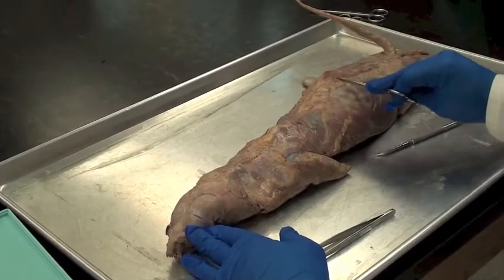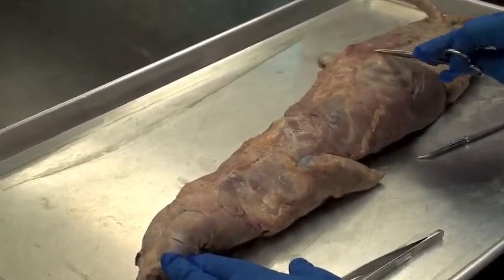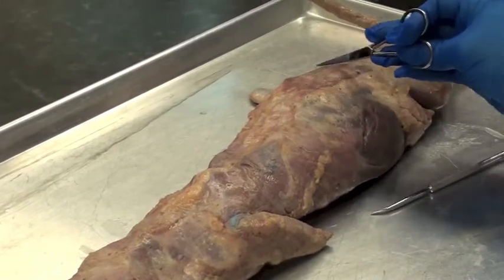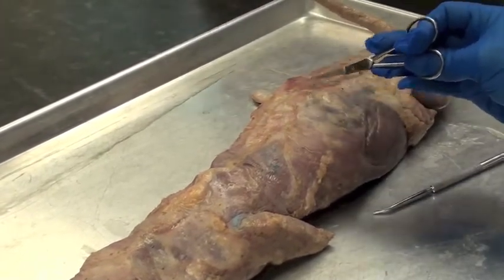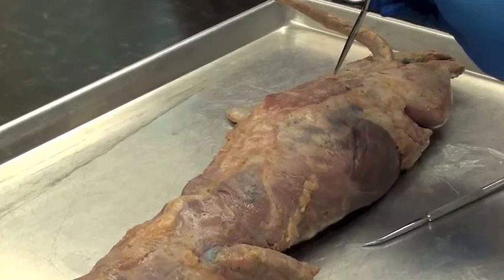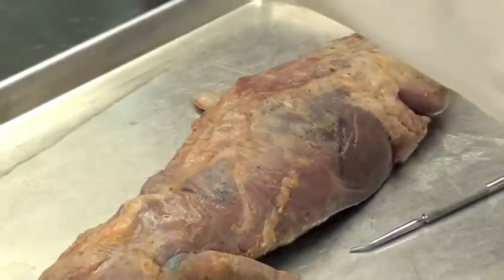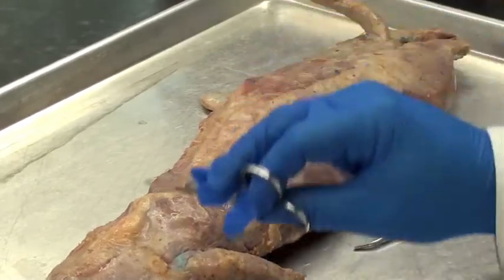What do you see here on the back? Just part of the muscle — this is called the cutaneous maximus, the word that means the big skin muscle overall. On this mink, not so big; most of it's been cut away here. That's its origin on the mink's lower back; it would go all the way up and wrap underneath the mink's underarm. In fact, on the mink down there, you can actually see the full length of this muscle overall.